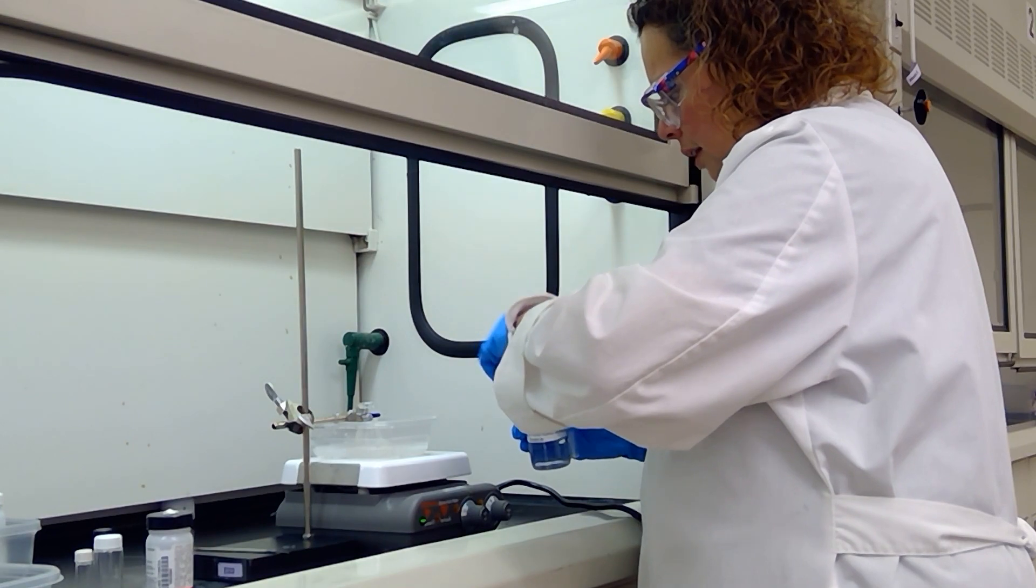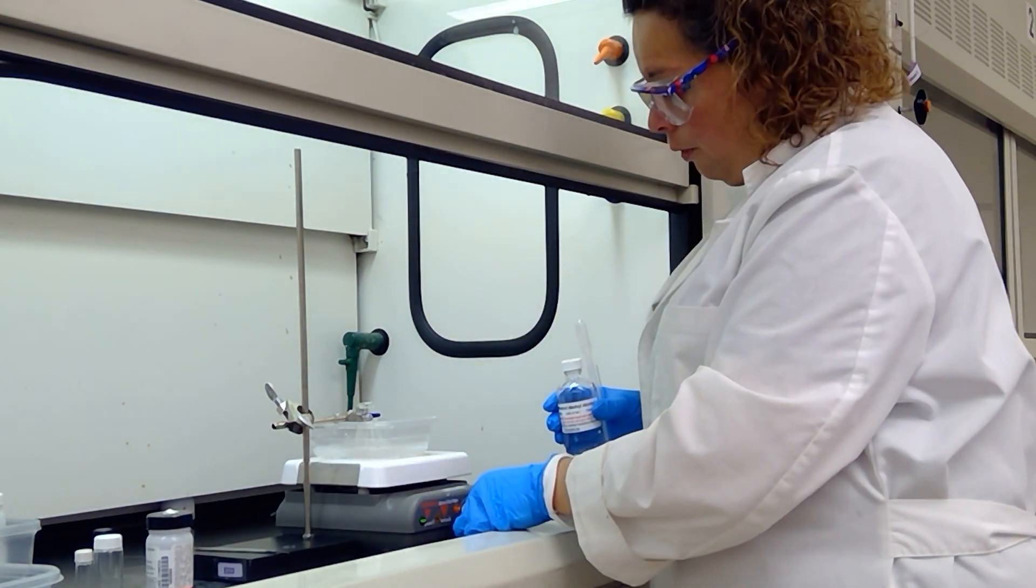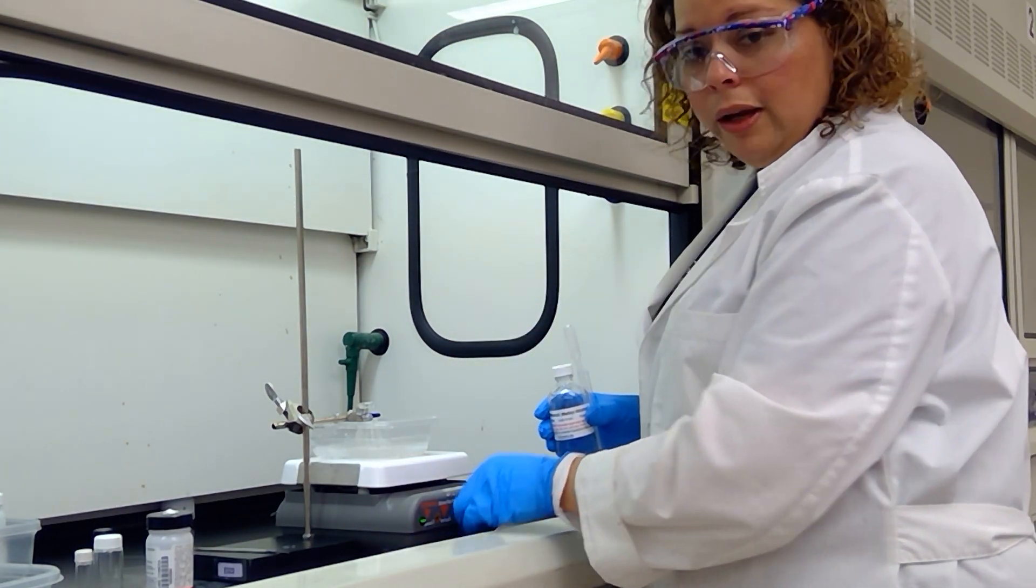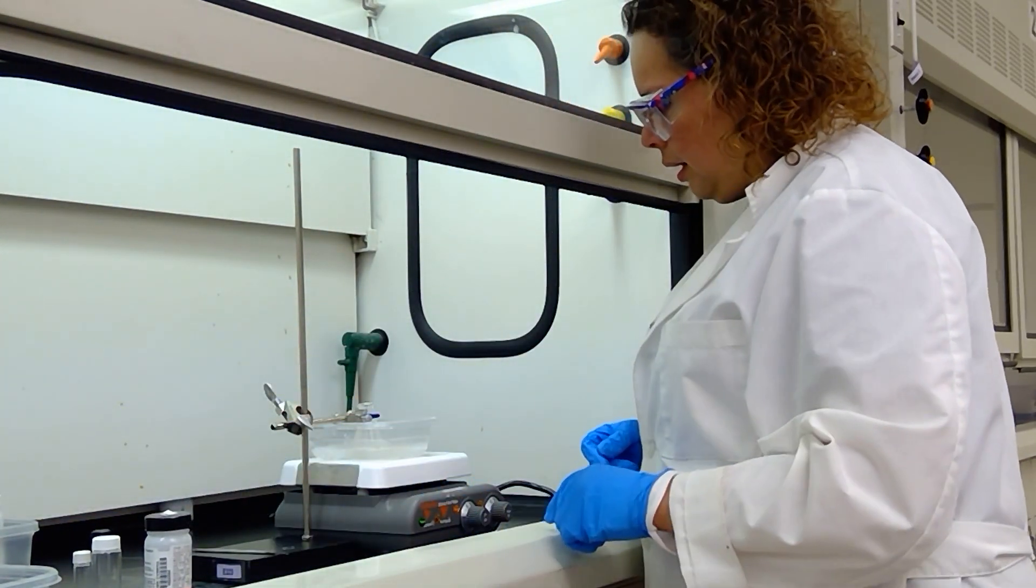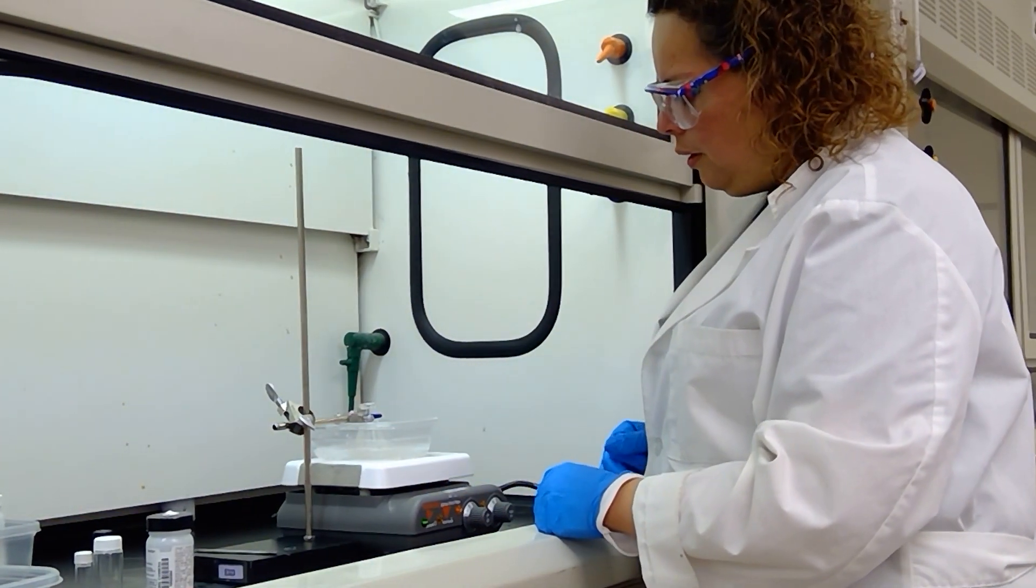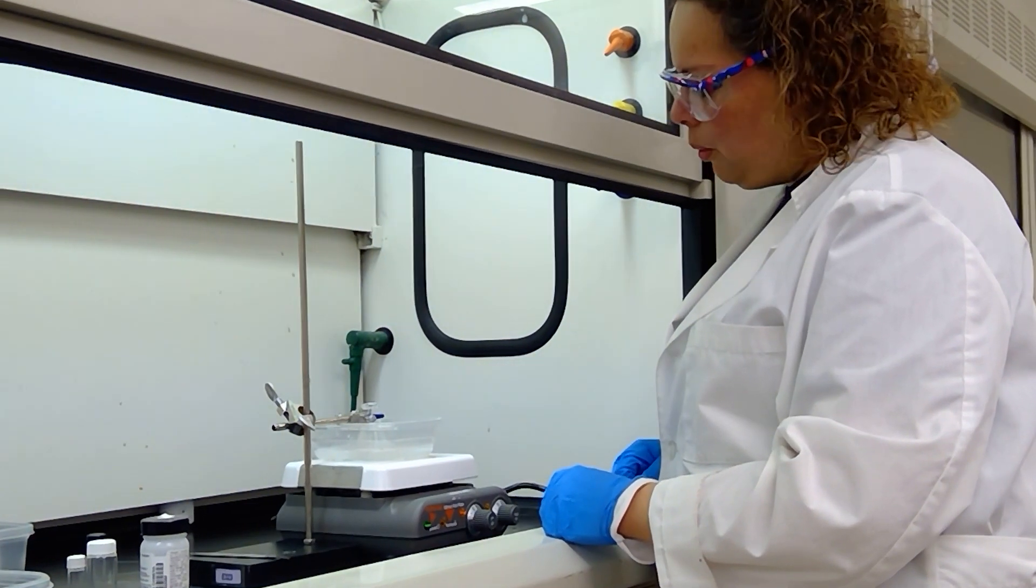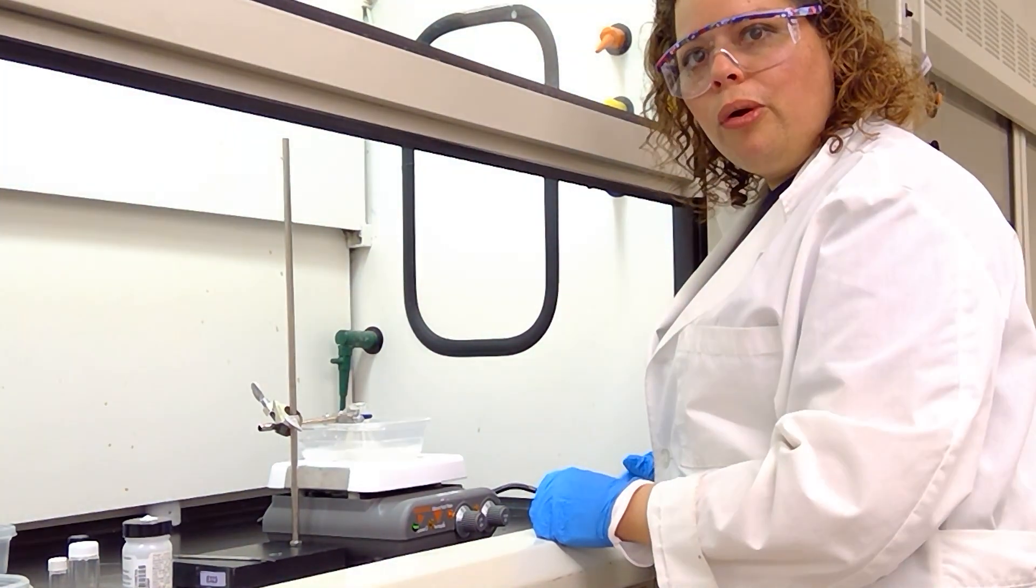I'm going to go ahead and start the magnetic stir bar. No heat for this experiment because we're going to generate some heat once we add the sodium borohydride, and I'm going to just allow the benzophenone to dissolve for a few moments before I start the addition of the sodium borohydride.